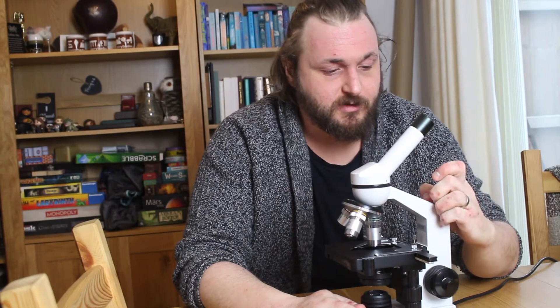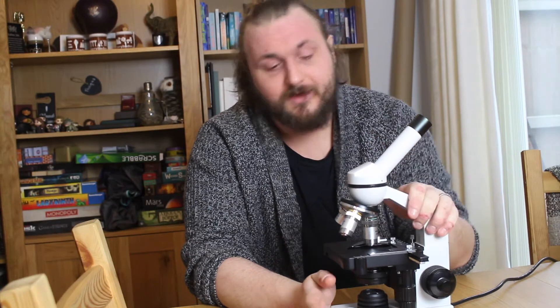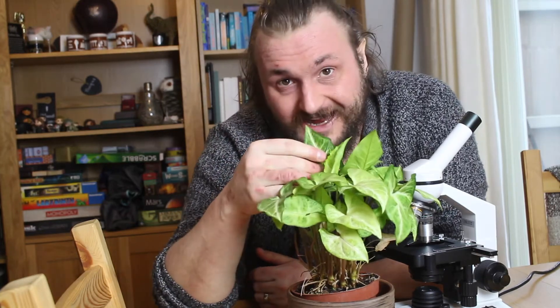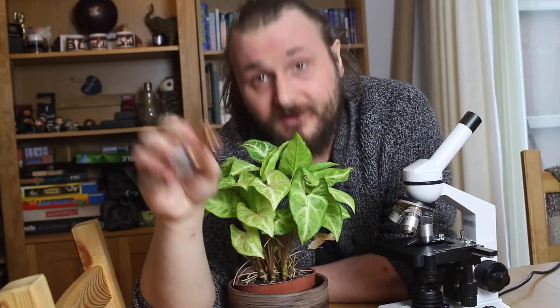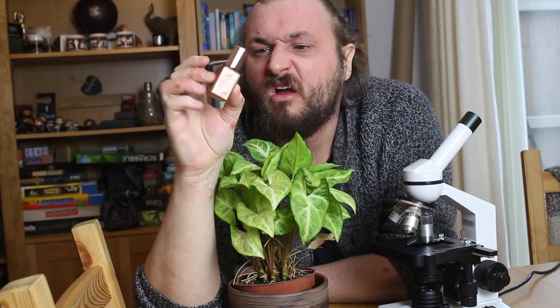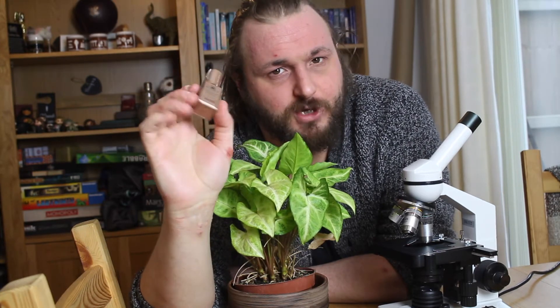This is something you might ordinarily do in school, but if you're not able to for whatever reason, you can watch this video. What you would normally do is use a microscope. You need a plant — this is a lovely plant I have at home with some lovely variegated leaves, which if you're doing the GCSE you should already know about. For this you also need some clear nail varnish. This is Sunset Daylight Curing Top Coat from Barry M. Any kind of nail varnish should do but it needs to be clear, because if it's colourful you don't see as much definition.